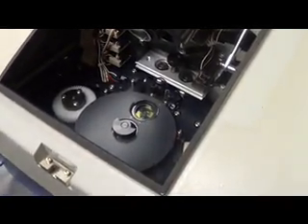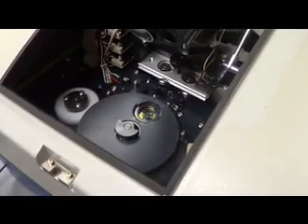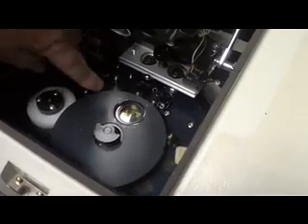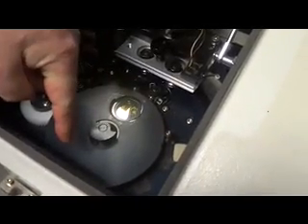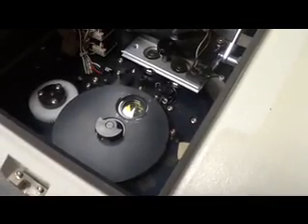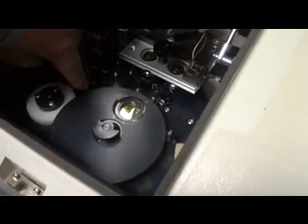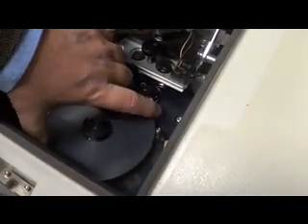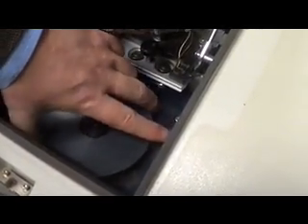After you've lifted up the PMT, you will notice a cover plate. This cover plate has three cutouts — one, two, three. You need to align these cutouts with the three pins. Once you align them, you will be able to take the cover plate off.